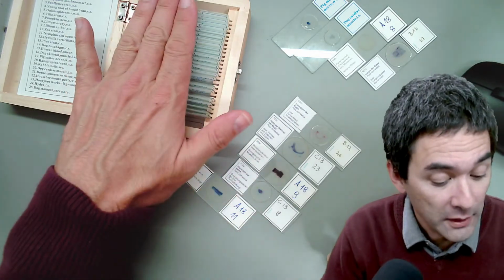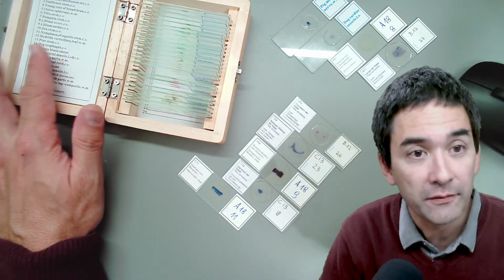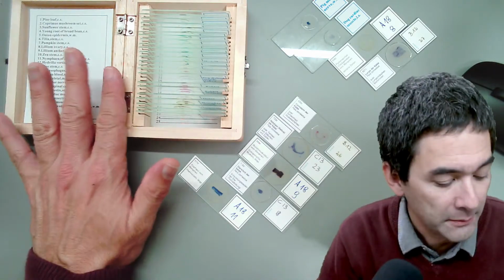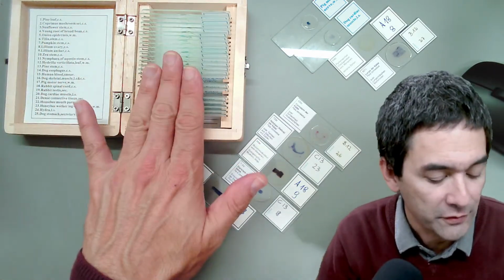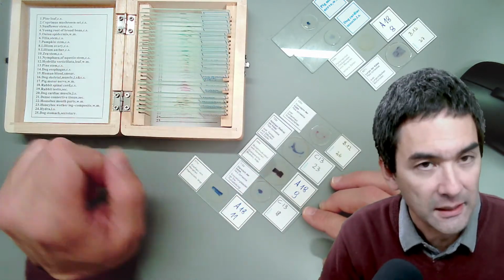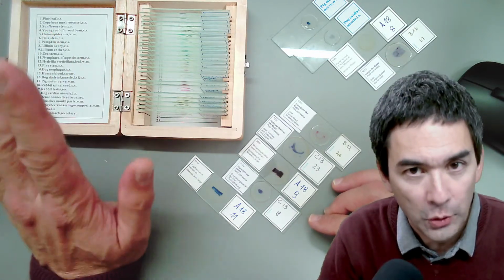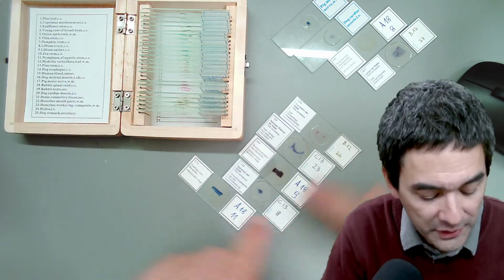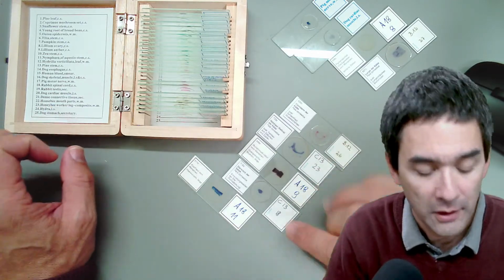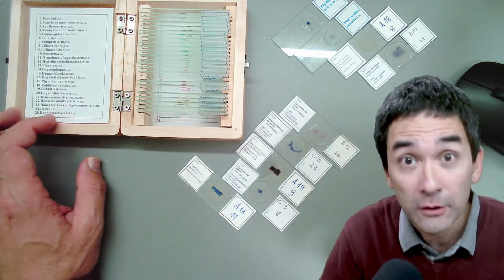So I would say if you don't have slides yet, and if you just want to have something to look at, get yourself a reasonably cheap slide. The price also varies from Amazon, but I do have to say that some of the slides that I bought from Amazon cheaply are not quite as good in quality as the other ones I have here, because those slides here are sometimes also used for medical training.